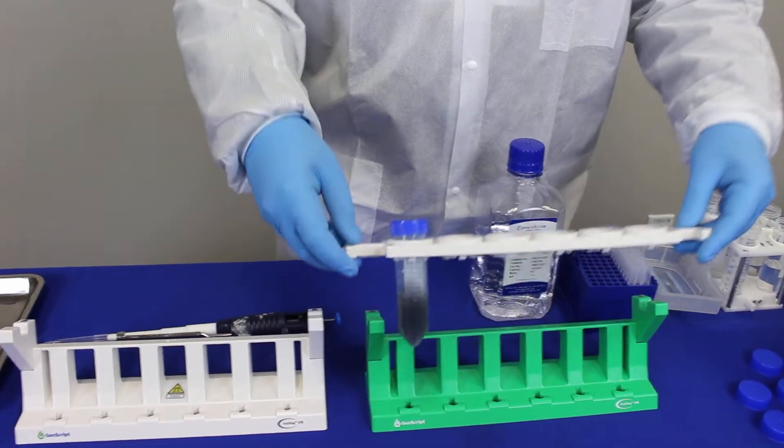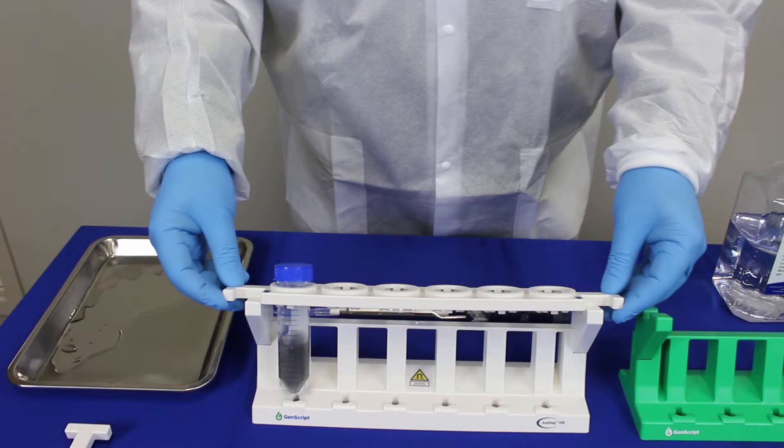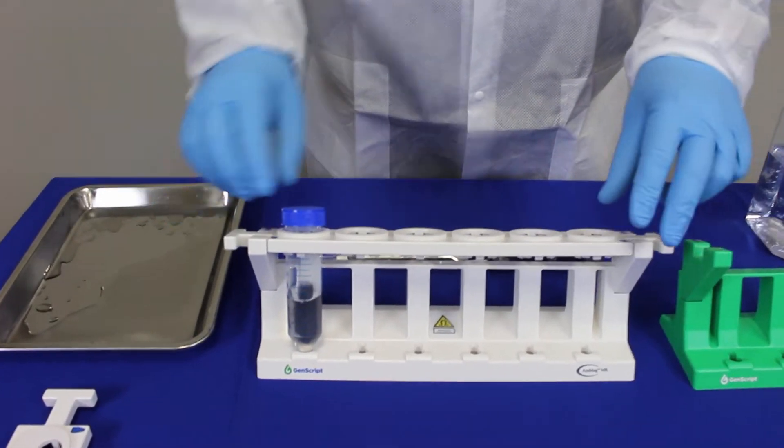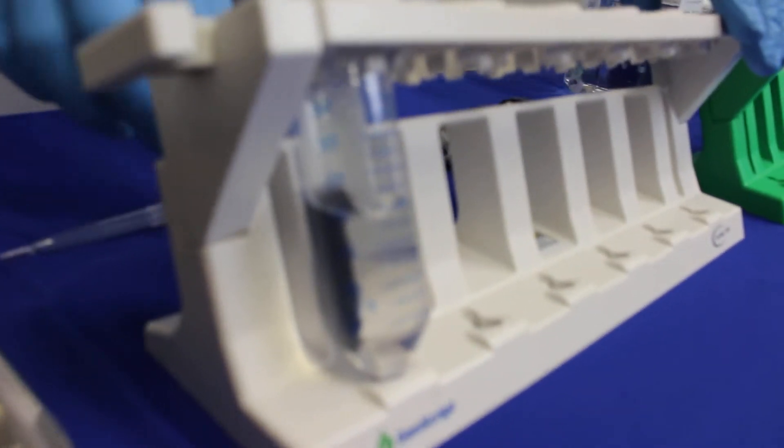Now you move this part of the rack to the magnetic component here, this is the magnetic rack, and now you see that all the beads are attracted towards the magnet.